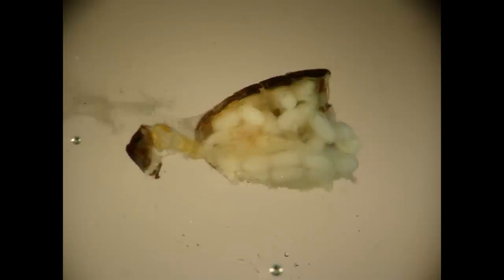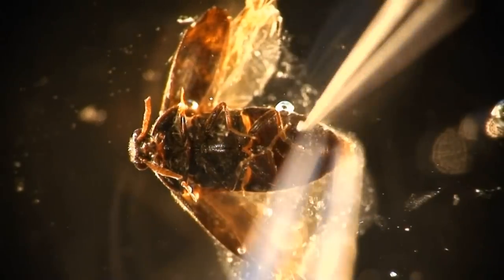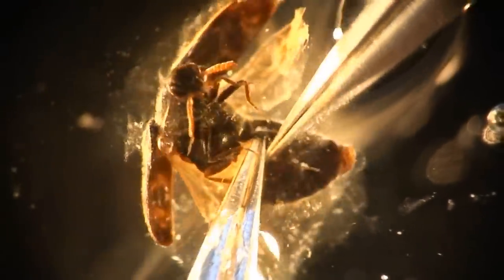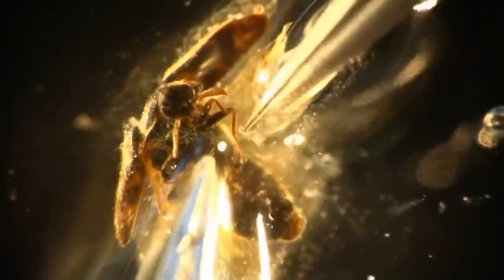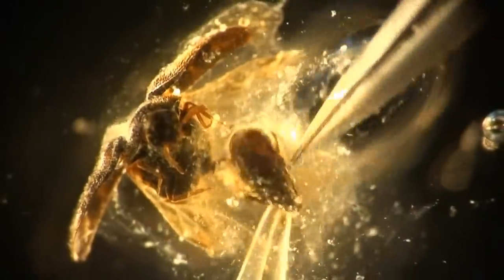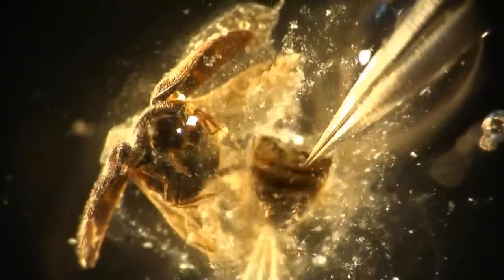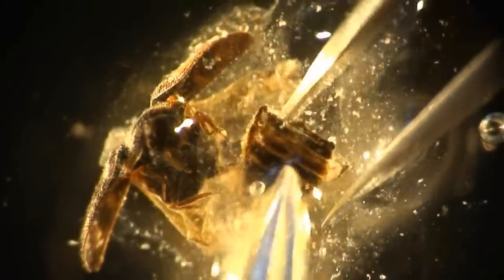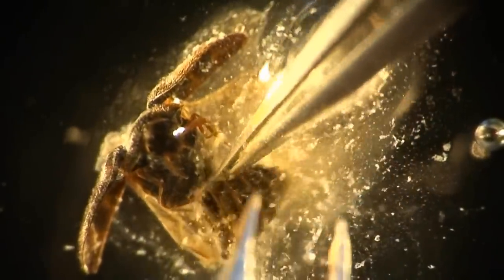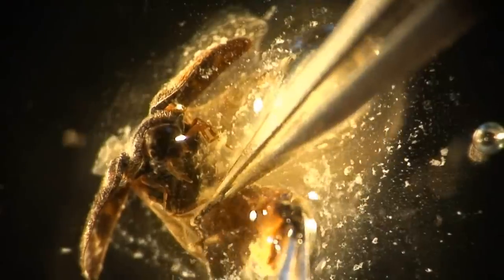In this image, you can see that the KOH has not properly dissolved the abdominal cavity contents. The abdomen should be placed back into warm KOH until the desired outcome is reached. With this specimen, we use a slightly different technique to separate the tergites. After separating the abdomen from the body, it is carefully held with one pair of forceps. The other pair of forceps are compressed and inserted into the abdominal cavity and then expanded. The abdomen should separate along the edges of the tergites, and can then be easily separated further if need be.